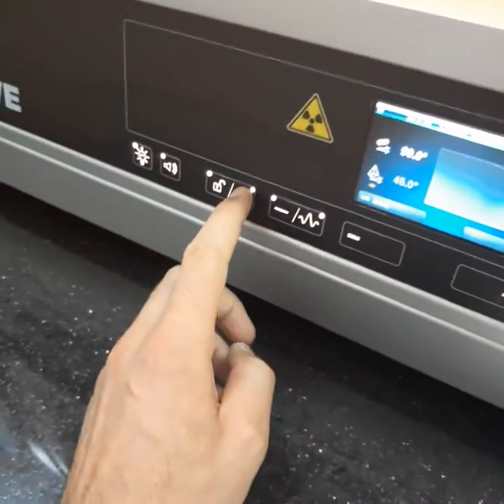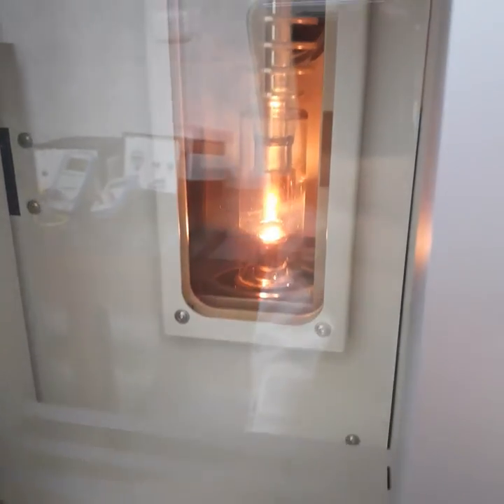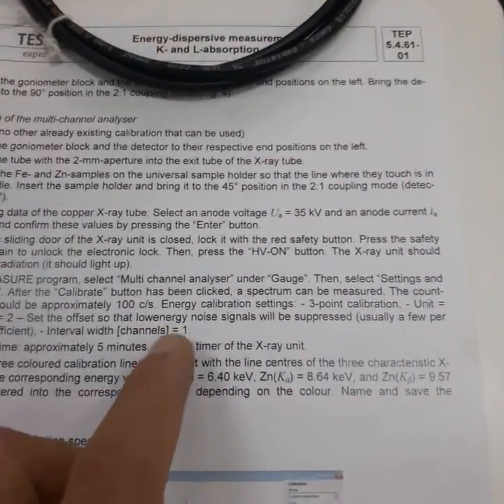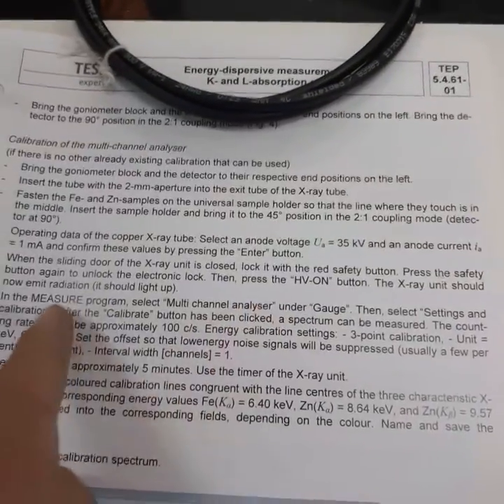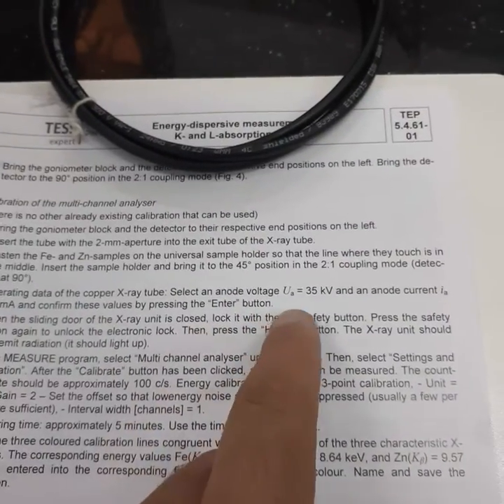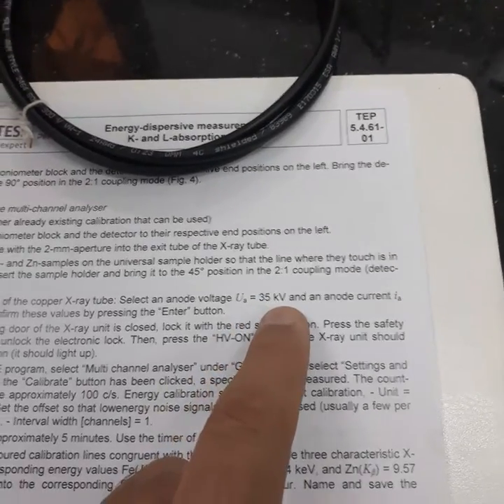We will close this door and then we will run the tube, and there is a radiation that will appear now. Now the tube is working very well. Then the next step is we will go to the Measure Lab software. Before that, we have set the current and the voltage to their maximum values, where the voltage is 35 kilovolt and the current is 1 milliampere.